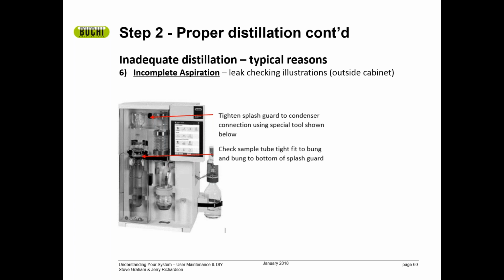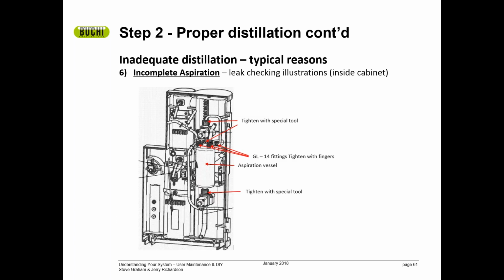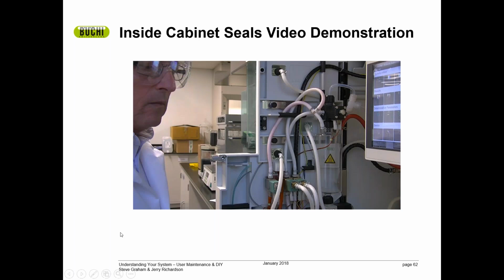So here again, we've already talked about the seals on the outside. Let's take a look at some of the seals on the inside. On the inside of the door of your system, there's several seals that are critical. I've highlighted those with red arrows. It's a little bit difficult to see all of the seals, but there's typically one or maybe two seals on the top or the bottom of the aspiration vessel. And we're going to take a look at the video to see which seals we're going to look at and pay attention to.